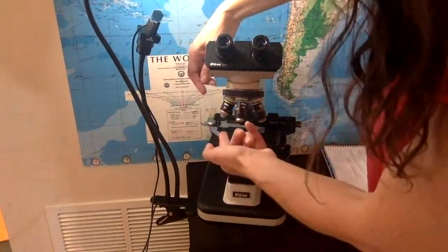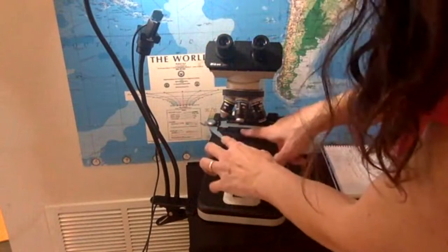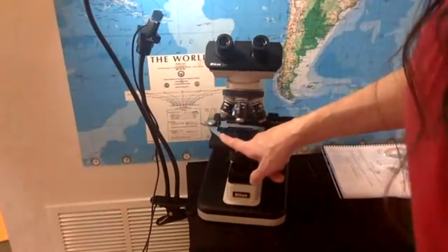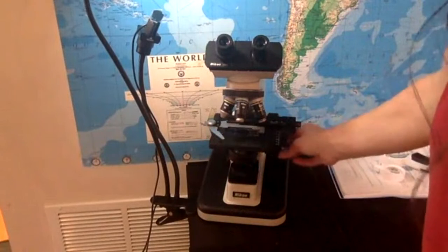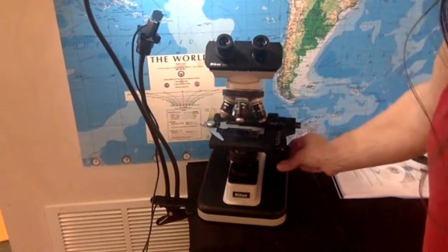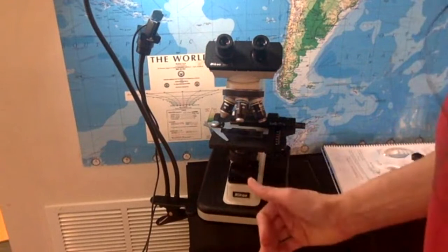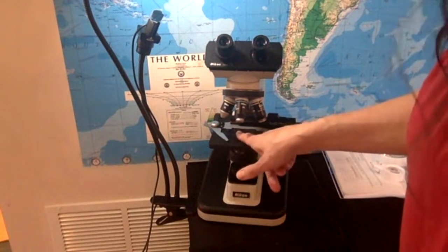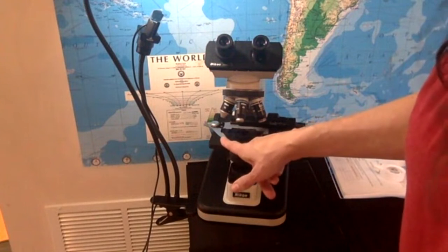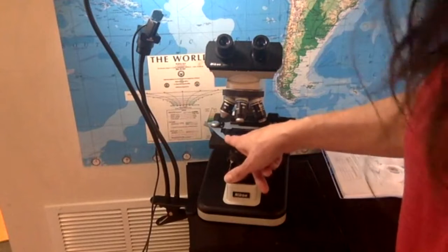Sometimes students lift this and they do actually more work than they're supposed to do. They stick the slide under the clip, and then this whole thing gets stuck. It bends this, and the translational controls don't work. So if I ask you the steps for setting up a microscope, and there is a step that says tuck the slide under the clip, you're supposed to say that's not something you should do.